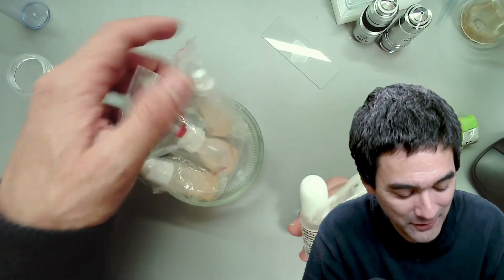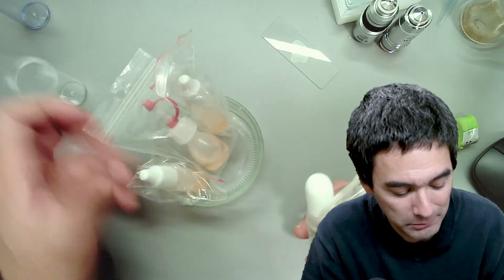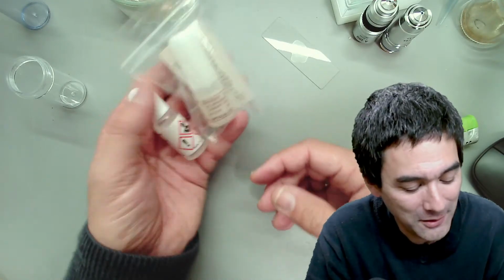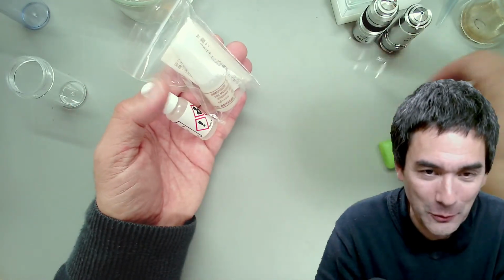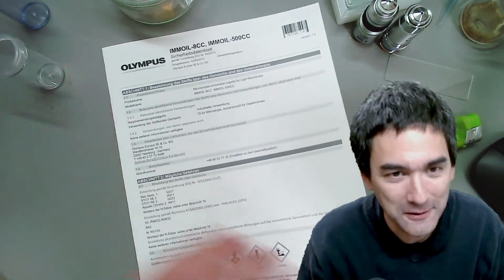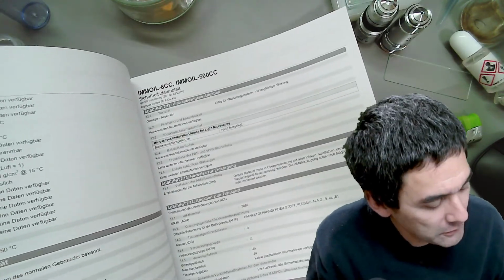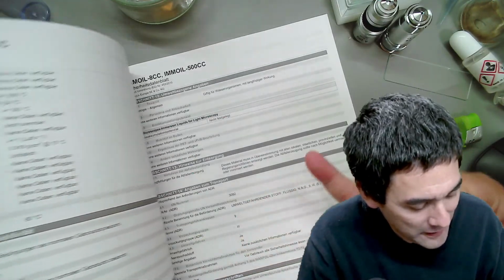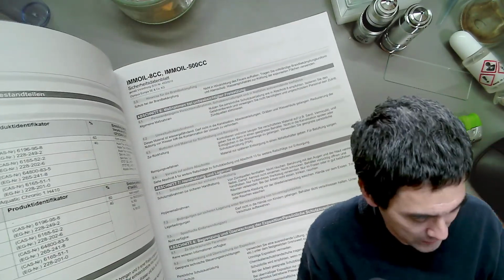Those from the low-cost microscopes just came in like this, and this one here is from the company Olympus. I don't expect them just to send you a bottle of immersion oil, but along with this bottle comes this here. I cannot believe this. A safety data sheet. When I first saw this, I said, oh my gosh, why that? It's all in German, all one language, on stability, reactivity, health issues, all of these things. It kind of scares you a little bit when you read that.